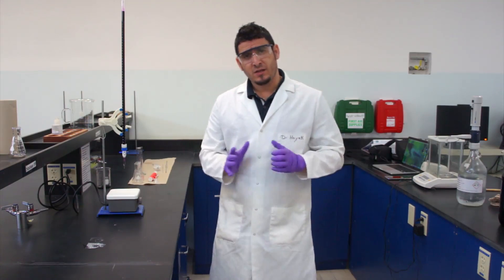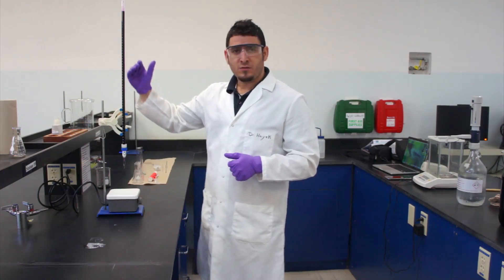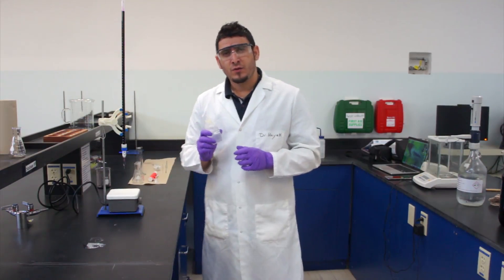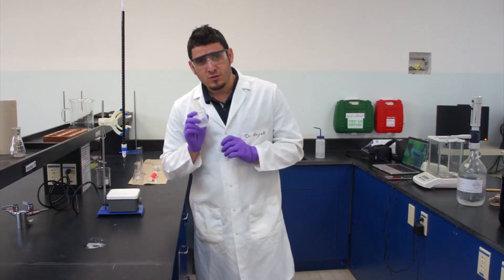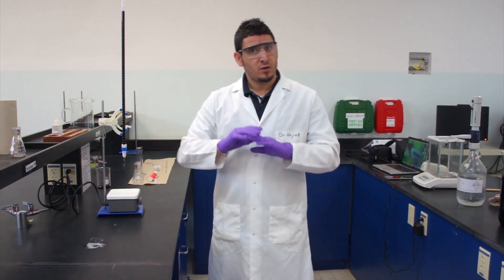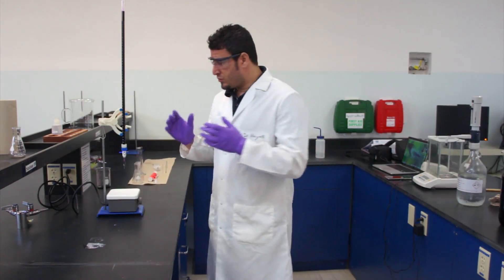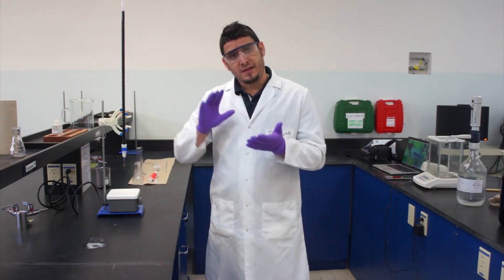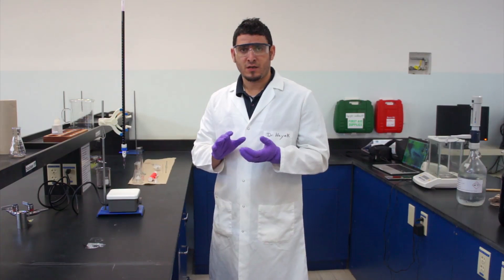Like any titration, I need to start with a rough titration so I know how much potassium permanganate I will need. Now, there is something very important: I don't know the mass percent or the concentration of this solution. If the solution is too concentrated, the entire volume of potassium permanganate in the burette may not be enough, so I need to check whether my dilution factor will allow me to use an acceptable amount of KMnO₄.